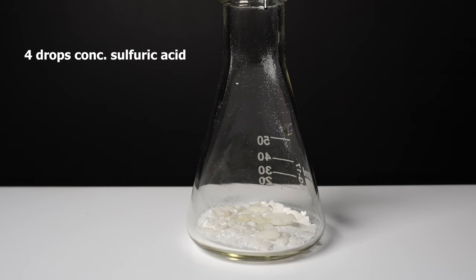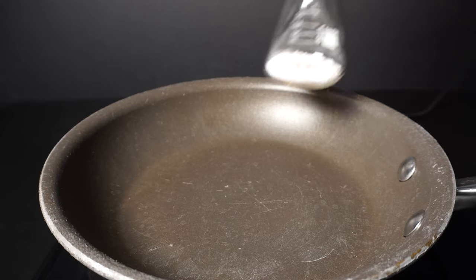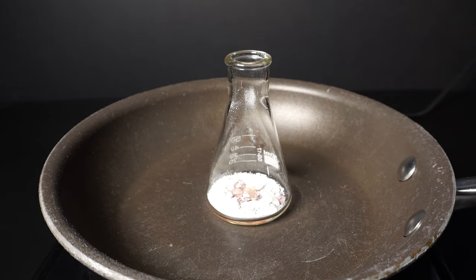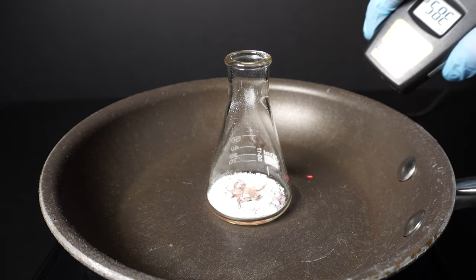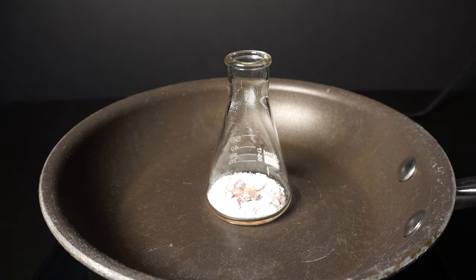My hot plate recently broke, so I'll be using an electric stove and a pan. However, this shouldn't be too much of a problem, except I will have to monitor the heat to make sure it doesn't go too far over 200°C.